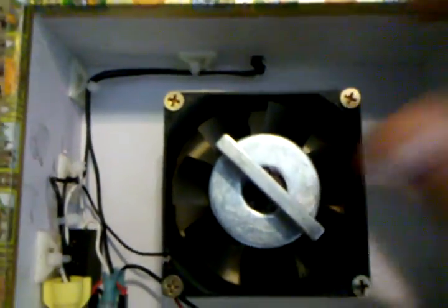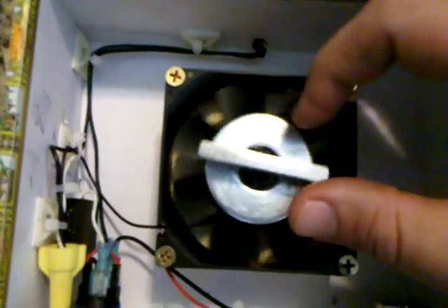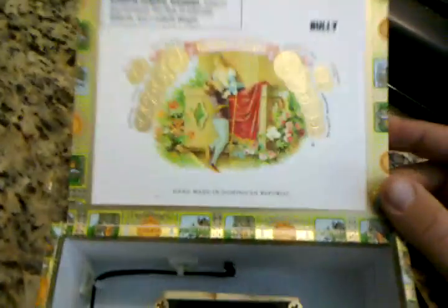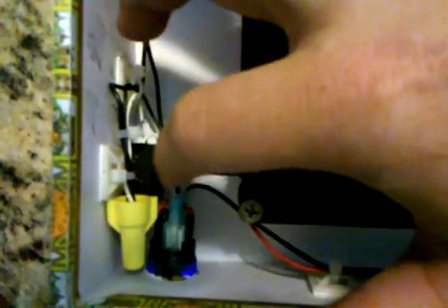This is the inside — it's an old computer fan with a washer and a magnet sitting on top of it, and that's sitting on a block of wood to raise it up right below the lid of the cigar box. Got it all wired up: rheostat, switch.